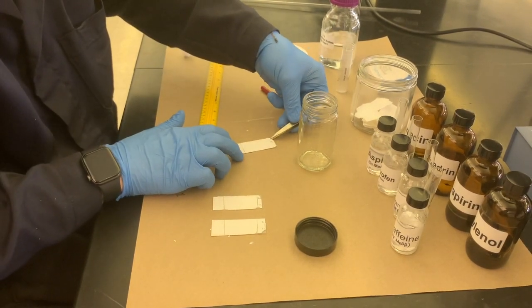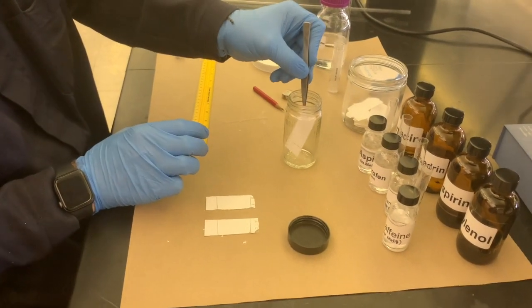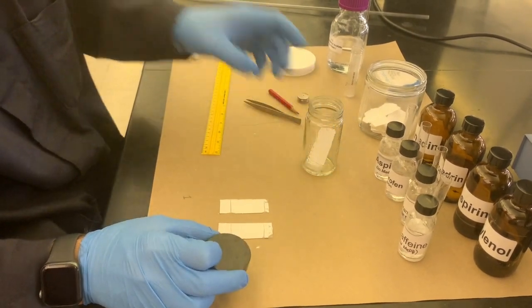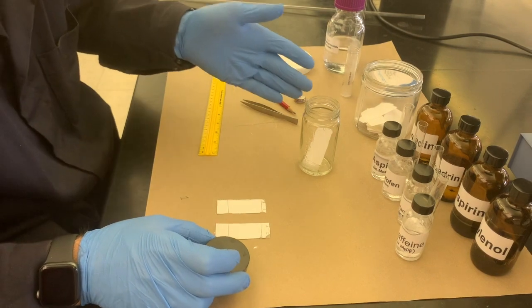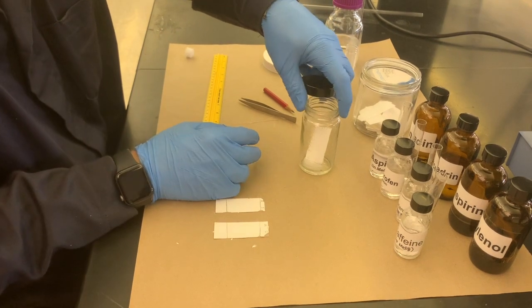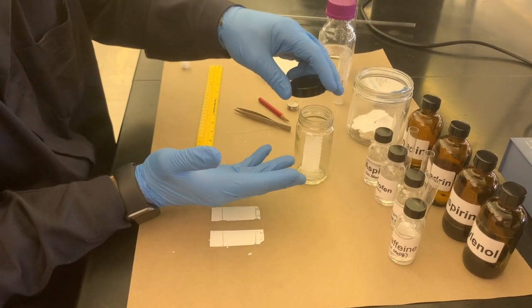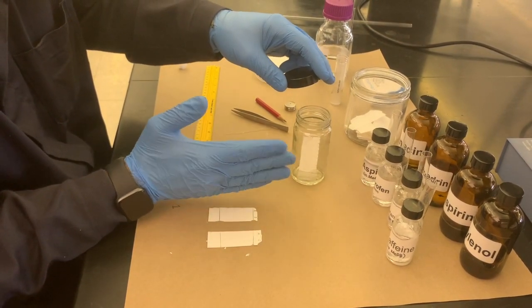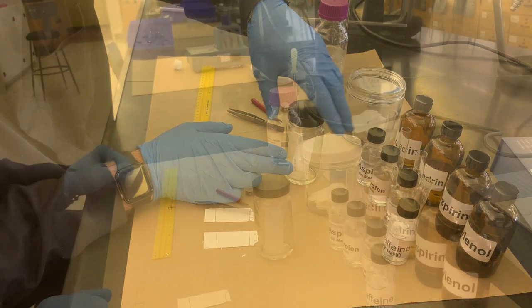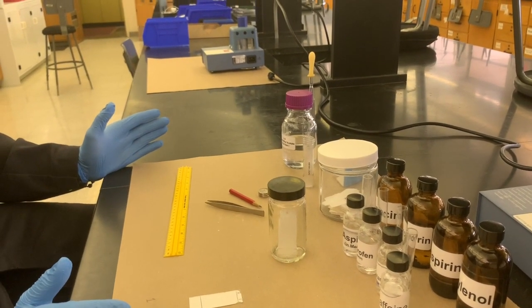So next thing, we'll take our unknown and put it into our chamber. Always set it as gently as possible in order to prevent any kind of splashing. I did my best here. We got a little bit of diffusion on the sides happening faster, but since there's only one sample, we're not as worried about it getting scattered across the lateral part of this stationary phase. Perfect. Okay. All right.